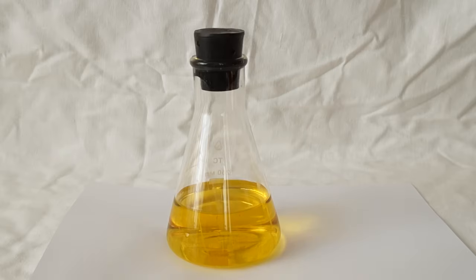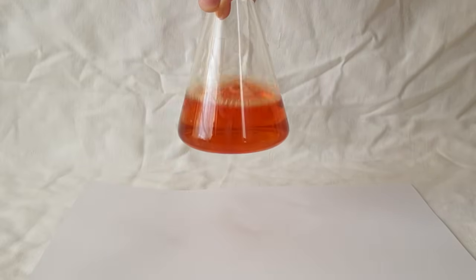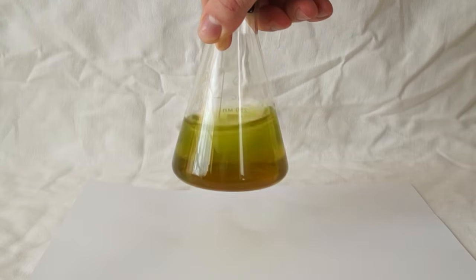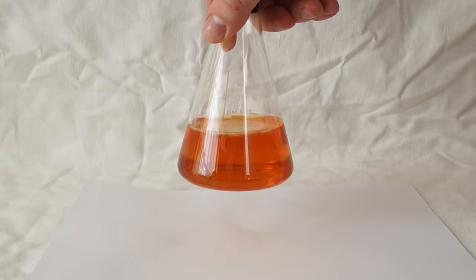However this is not all. This reaction can be reversed simply by shaking the solution. With a weak shake the solution becomes red and with a strong one it turns green. Then the reaction proceeds into the opposite direction: green, red and yellow.